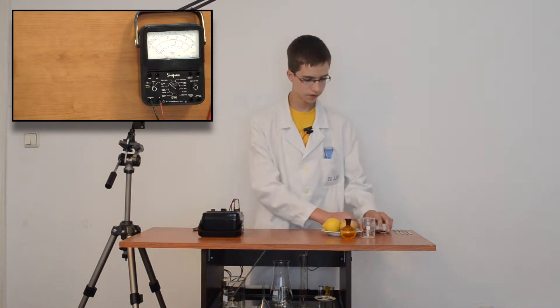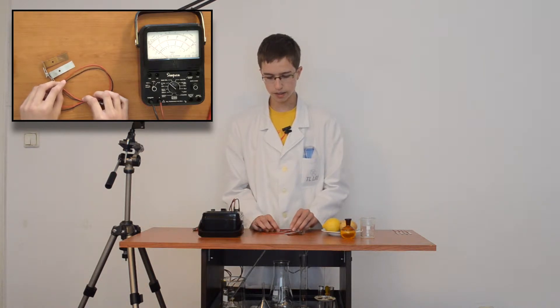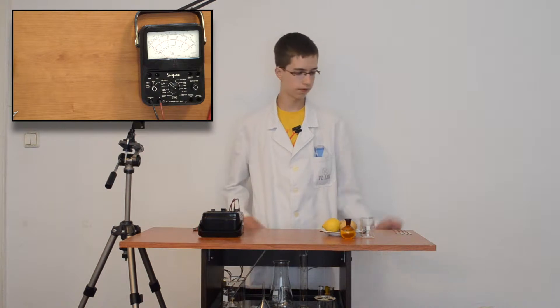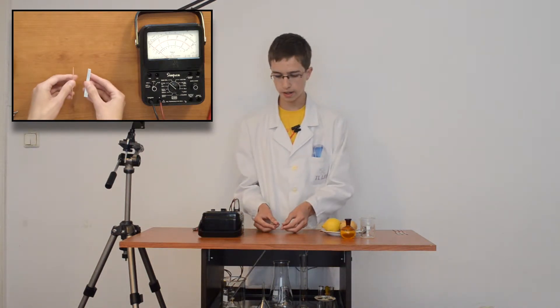In all cells I'll use zinc and copper electrodes — copper for positive and zinc for negative. For these electrodes you can use a piece of copper wire and a piece of zinc metal. Here we have original electrodes for doing chemical experiments. Also for the zinc electrode you can use a piece of tin coated with zinc, or a galvanized nail. Here we also have homemade electrodes.